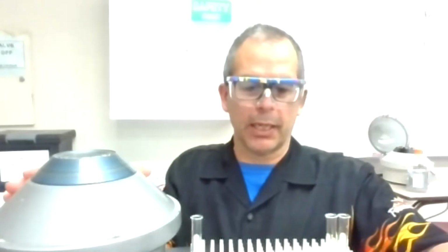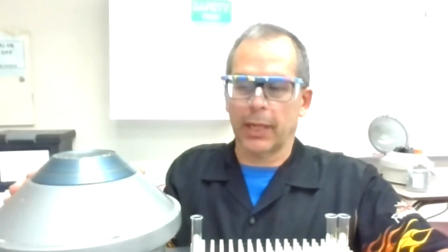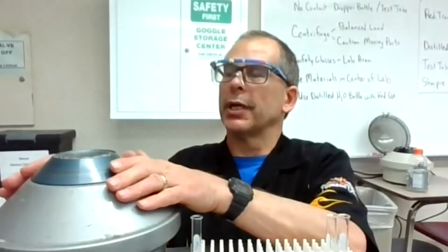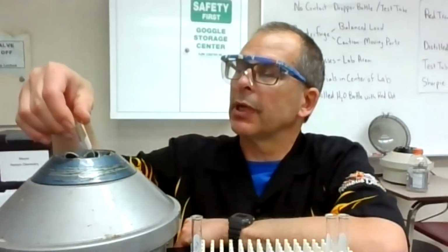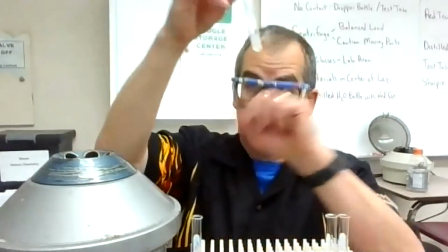That was the FeCN6 minus 4, which was the second thing that I added to this. I'm just going to let that go a little bit more. Hopefully this comes out. I don't like to take too long, but I like to make sure it has time to separate so we don't have to redo it again. It's really important to mix it too so it separates. Sometimes you do everything right and it just doesn't seem to separate like you want.